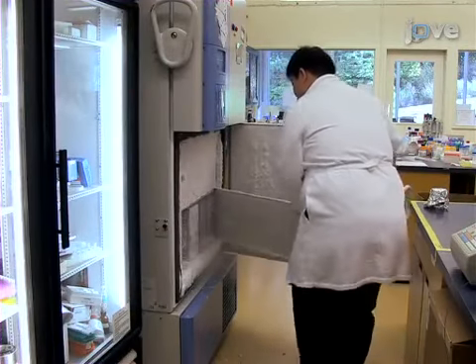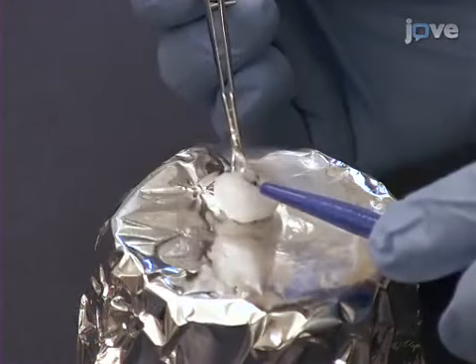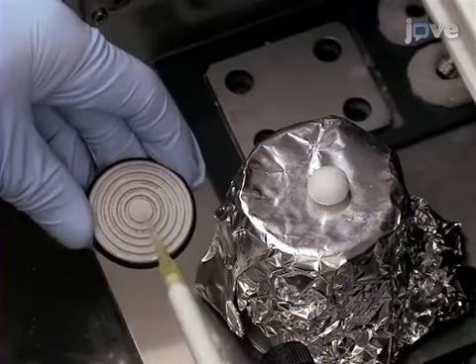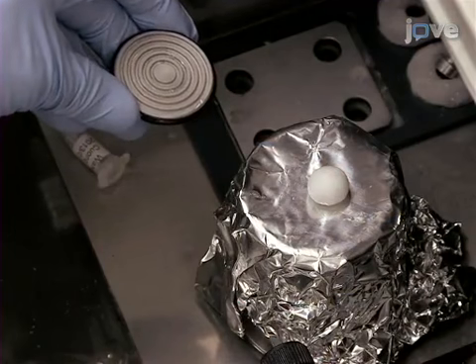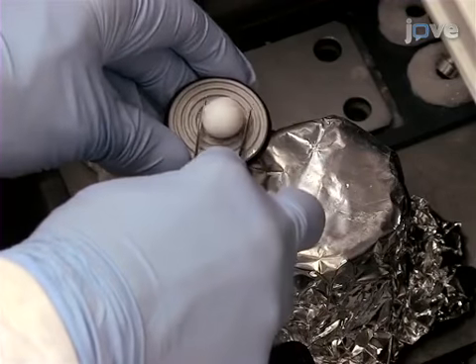Remove the flash-frozen tissue specimens from -80°C storage. Remove the capsule from the surface of the lens. To fix a whole bovine calf lens section, place 1 or 2 drops of water on the tissue cutting stage of a cryostat. Quickly place the lens in the water before it solidifies.